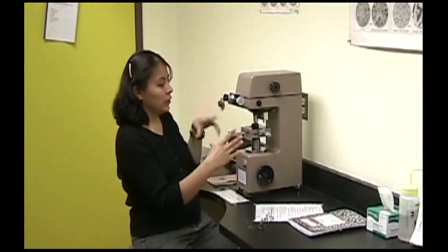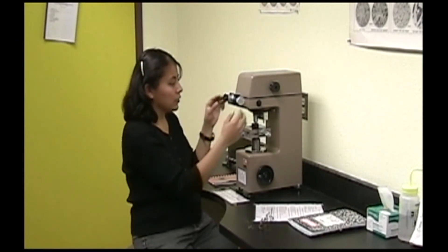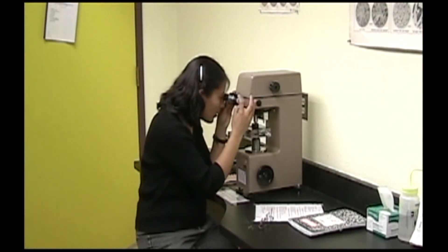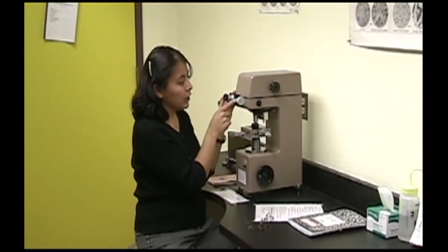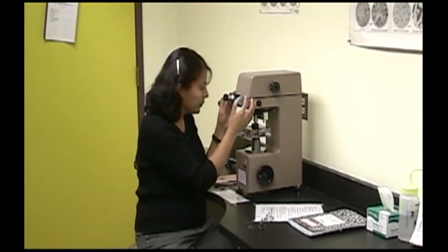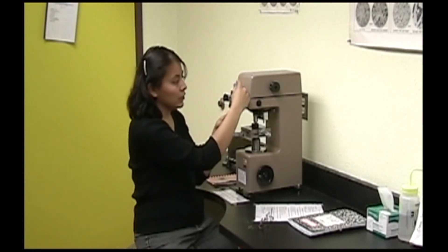You've made a diamond-shaped indentation with one diagonal and another perpendicular to it. To measure the first diagonal, move the crosshairs perpendicular to it, barely touching the corners. Read the measurement here — each increment on the barrel is 50 units and each increment on the drum is one unit. Then turn to measure the other diagonal.